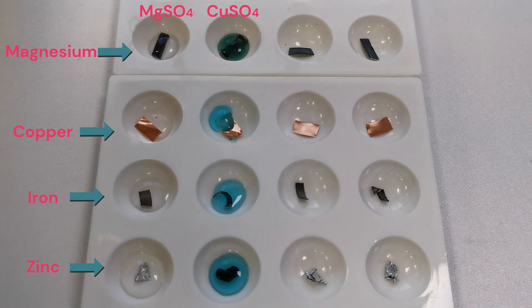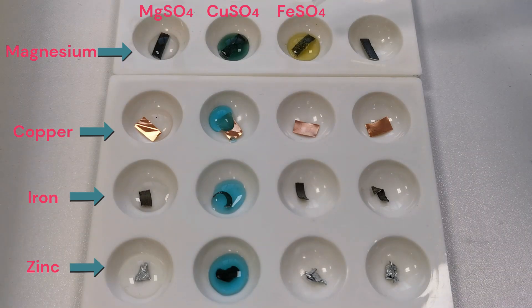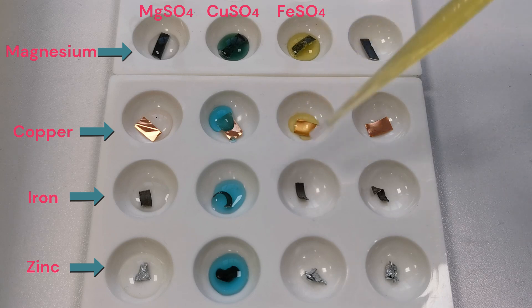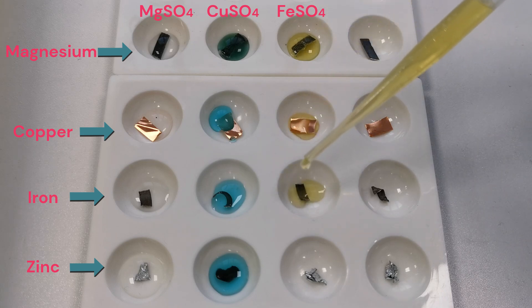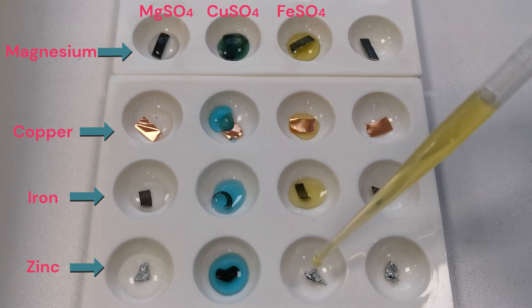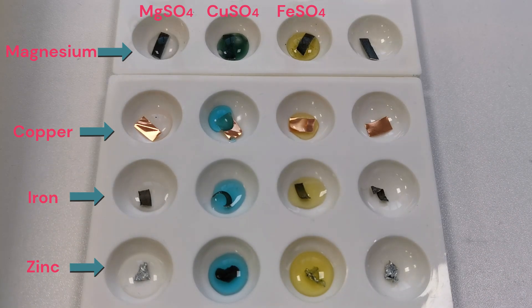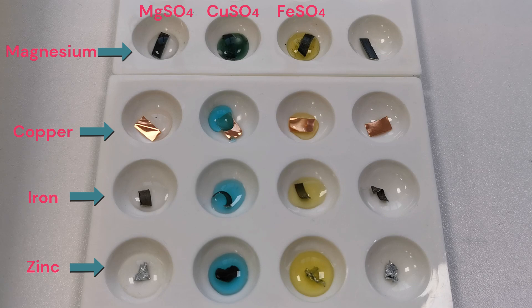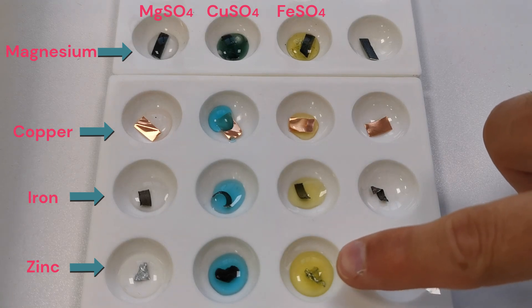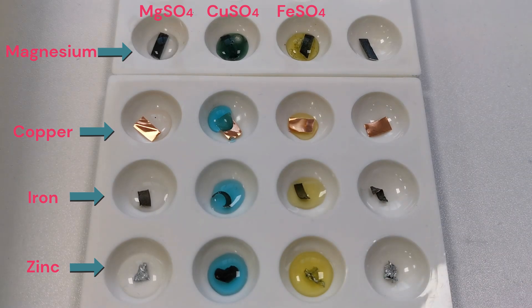The next solution we're going to add is iron sulfate. Instantly you can see a reaction with the magnesium — there's lots of fizzing and bubbling. There doesn't seem to be any reaction with the copper or the iron. There does seem to be a very slow reaction happening with the zinc and the iron sulfate — some bubbles are forming, just very slowly.